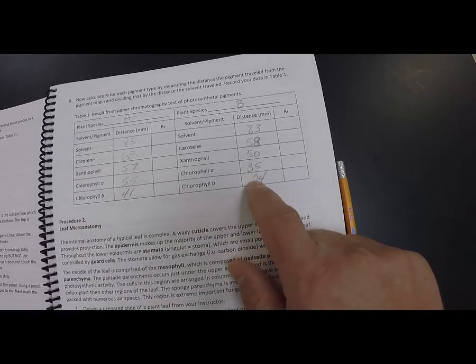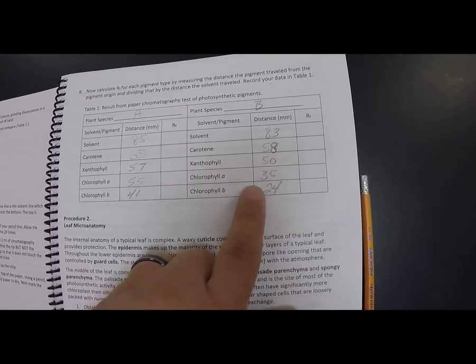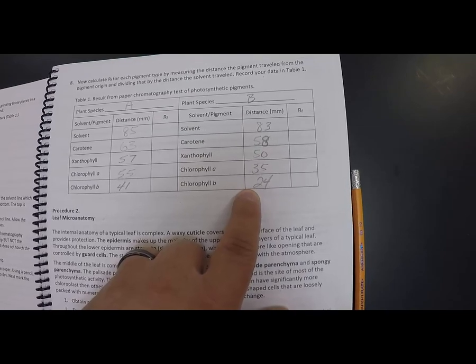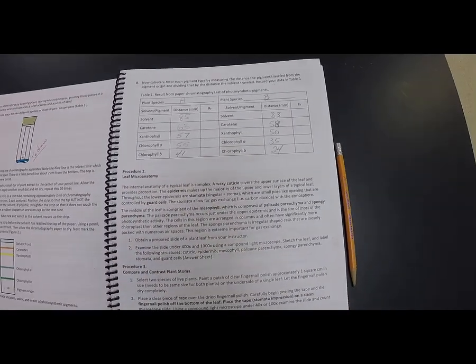These molecules could be bigger as long as we did it correctly and about the same amount of pigment was laid down. Then plant species B might have heavier molecules. Maybe not, but at least we can calculate the RF factor. It gives you an example of the distance traveled, and different RF factors will allow you to differentiate between different plant groups. So you can tell these two different plants have different RF factors. So first for you guys is to calculate out that RF factor.